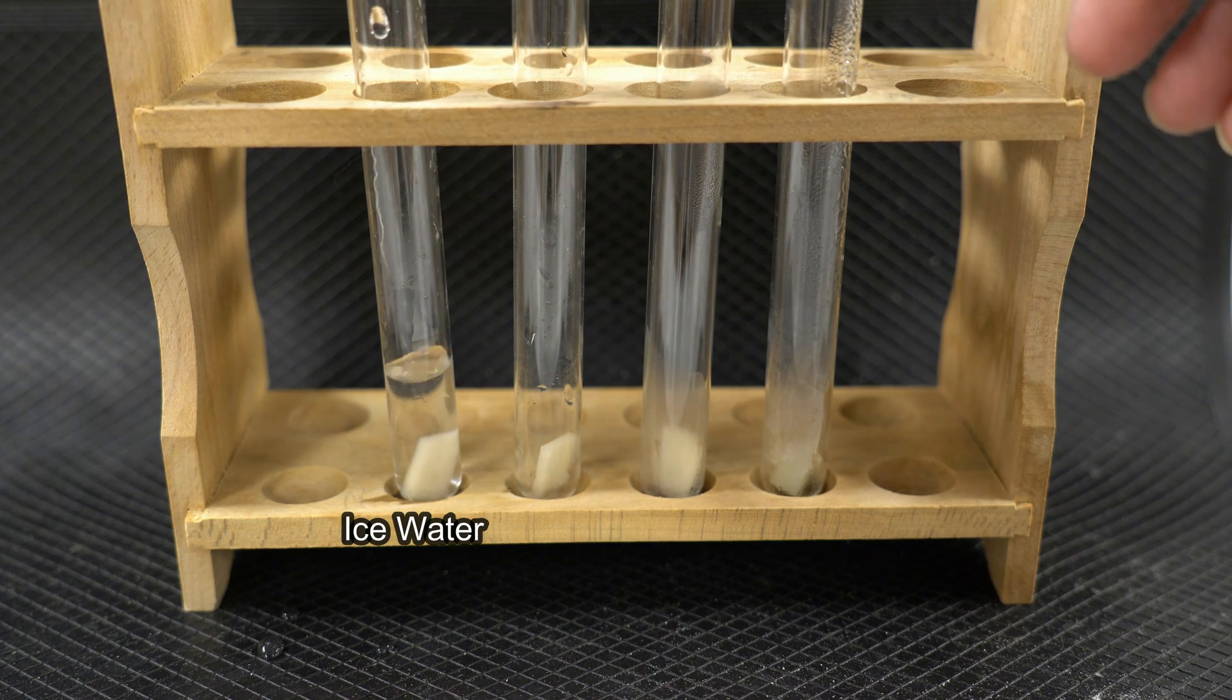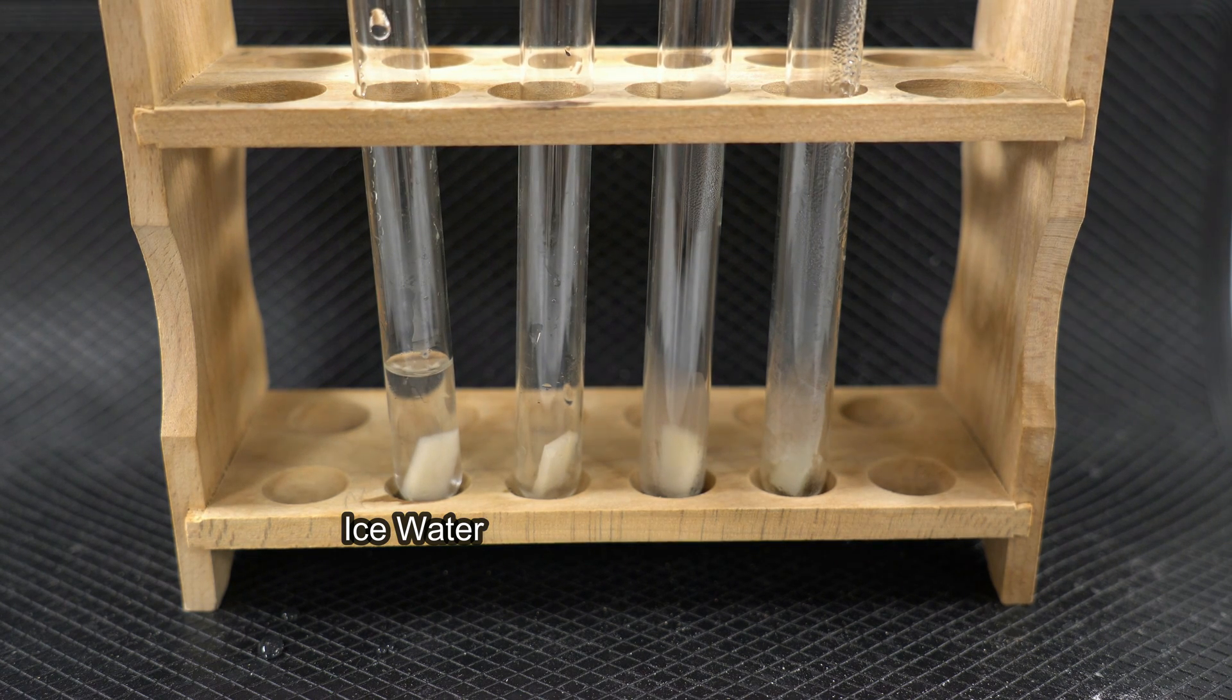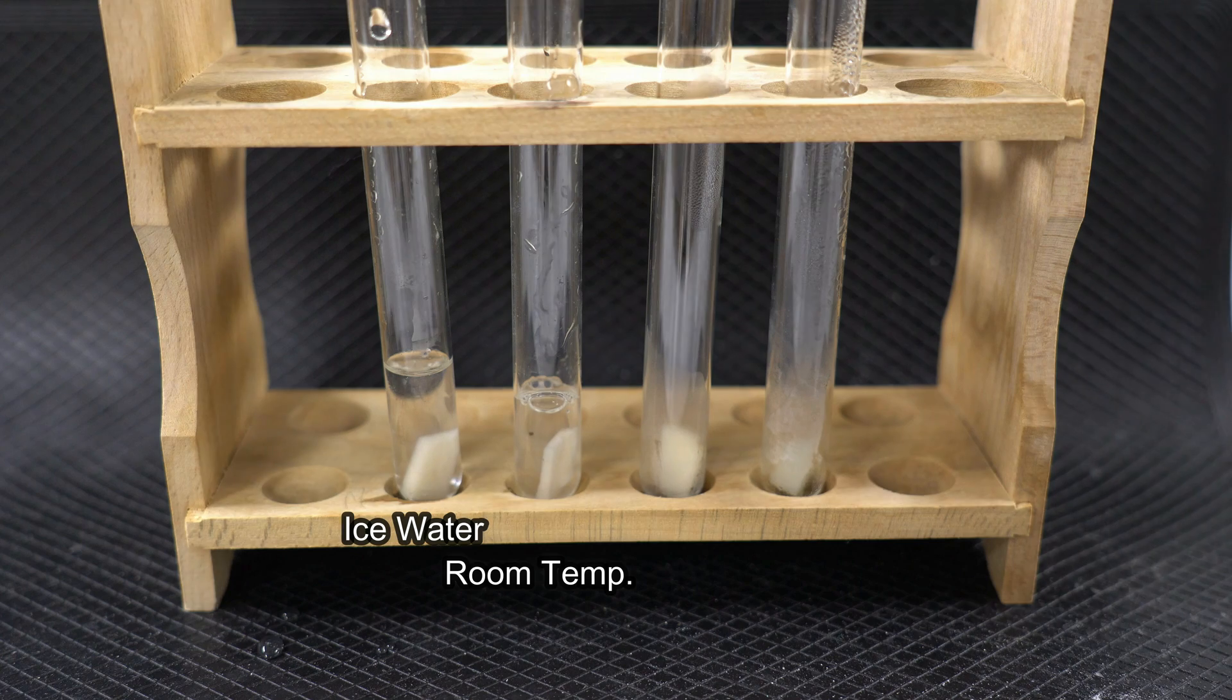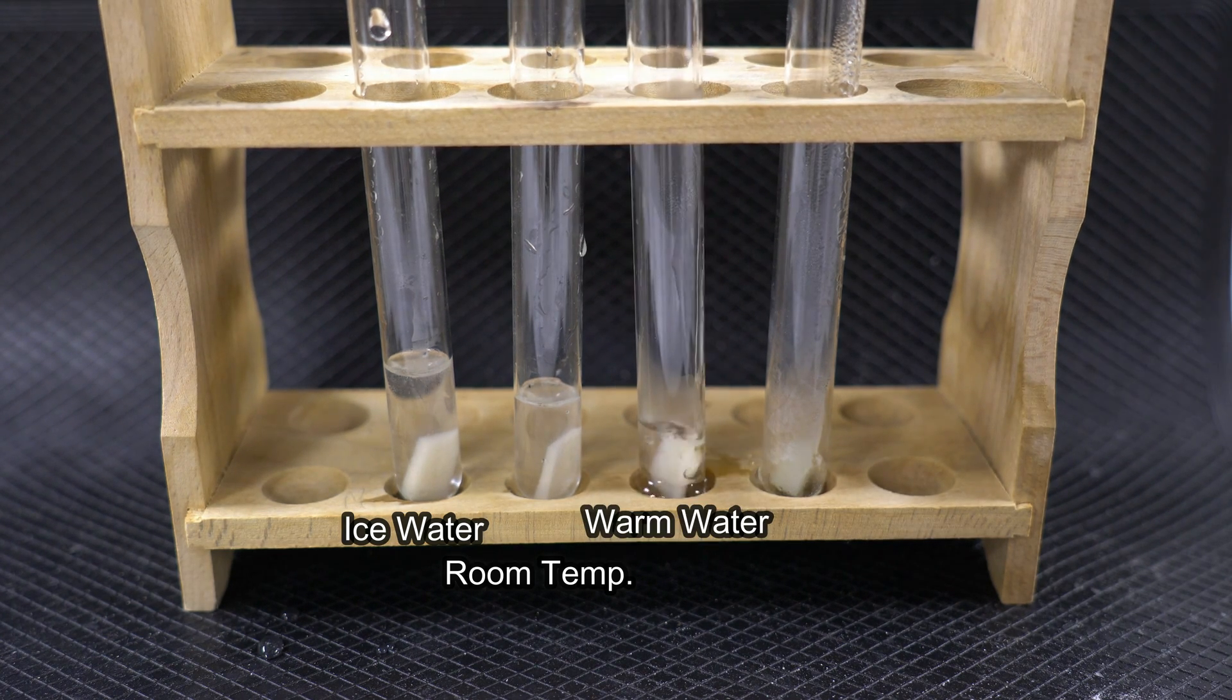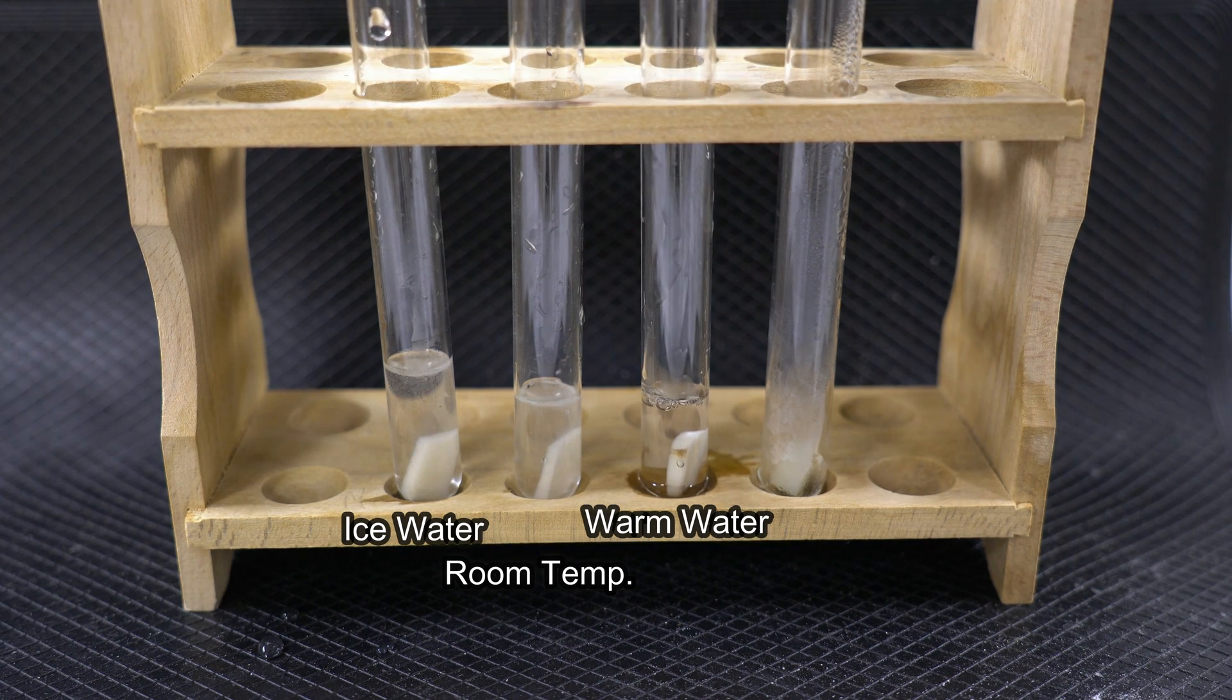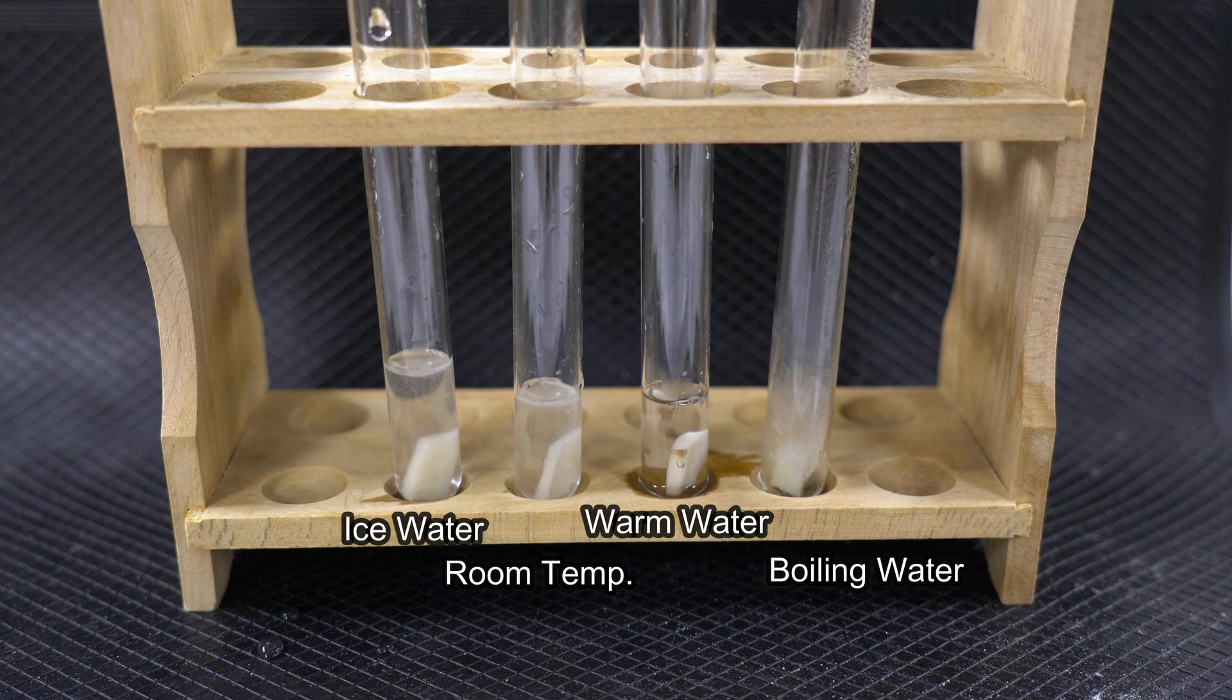So again, that's the ice water, this one is room temperature, then we have warm water, and then boiling water.